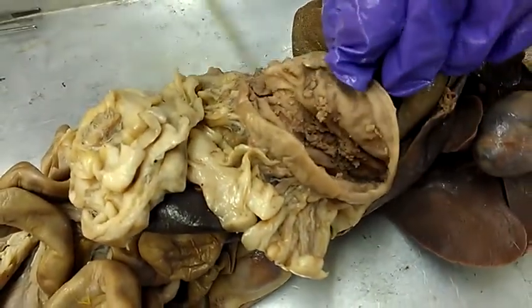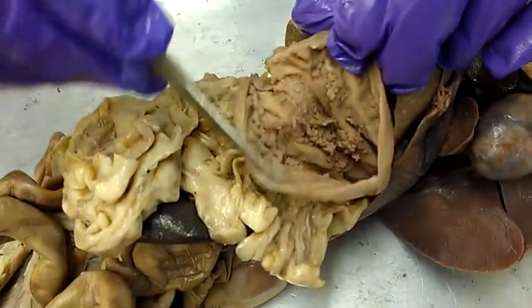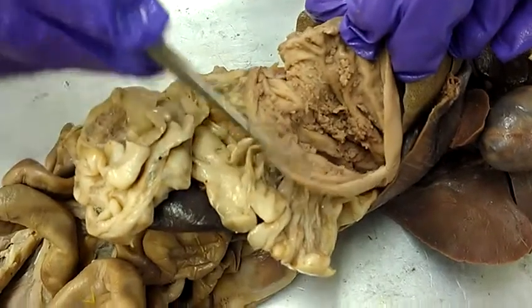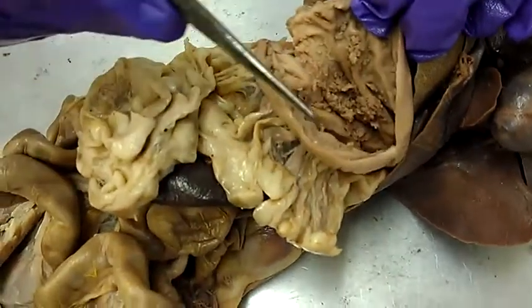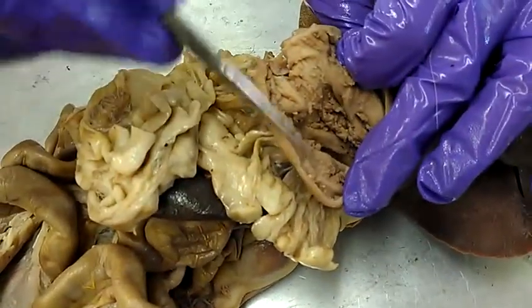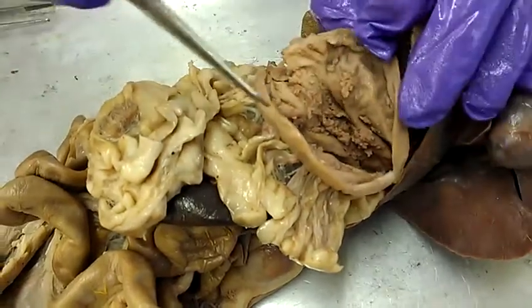Come on over here — inside the stomach is cat food and worms. These are the rugae.